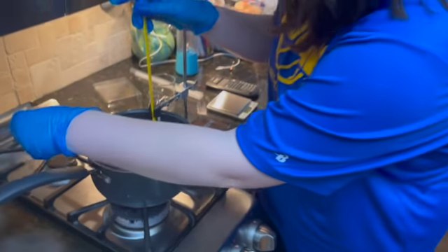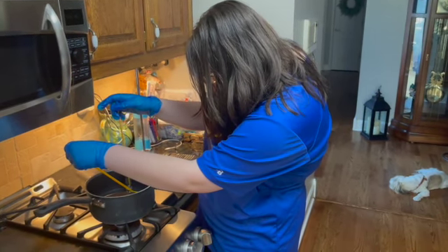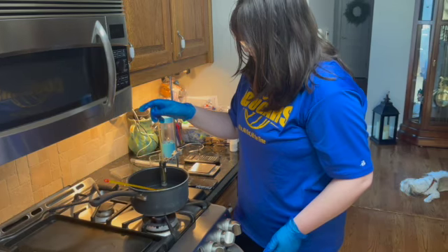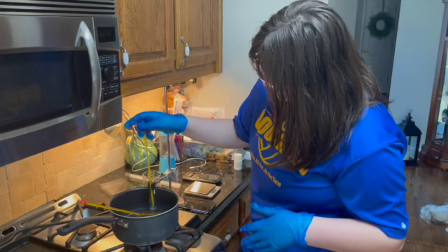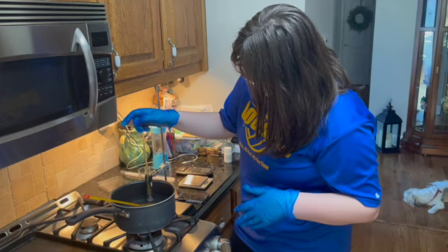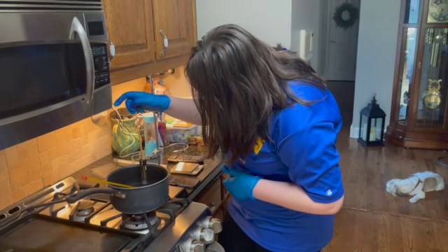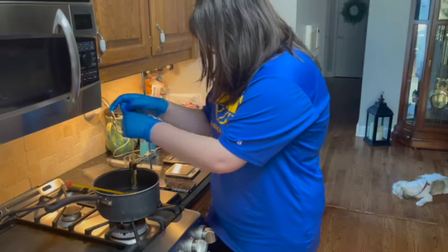And now we are at the 9-minute mark, and our temperature for our solvent is 53 degrees Celsius, and our hot bath is still at around 55. It'll take a little bit of time for it to simmer down just a little bit. It's still within range, but we want to get that down as close as we can. Okay, so we are now reaching 10 minutes, and the temperature of our solvent is at 54 degrees Celsius, and our hot bath is at 55 degrees Celsius.